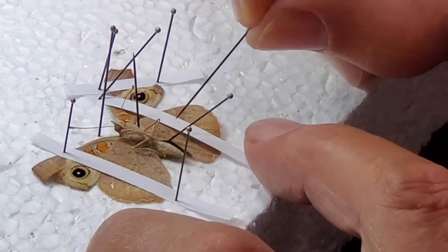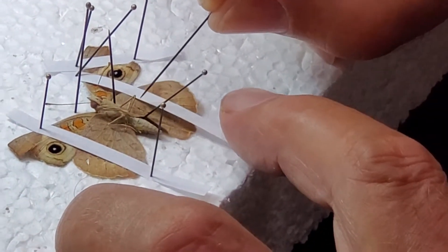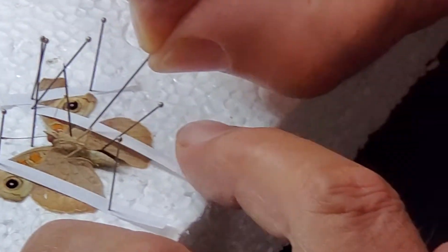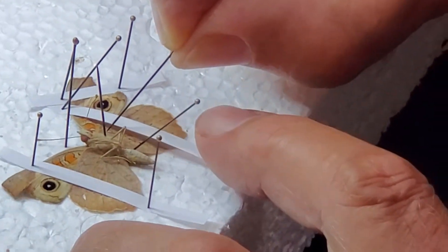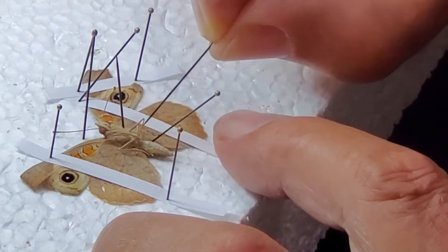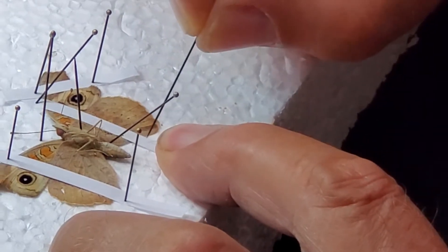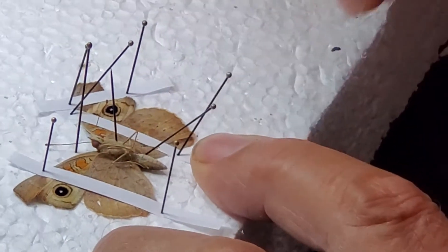It's the hind wing. I'll repeat what I just finished. See if I can snag a vein, move it up, at the right size notch, get that wing down quick.